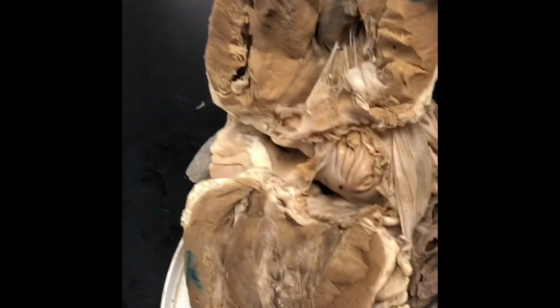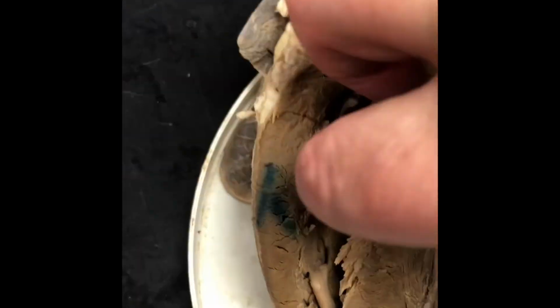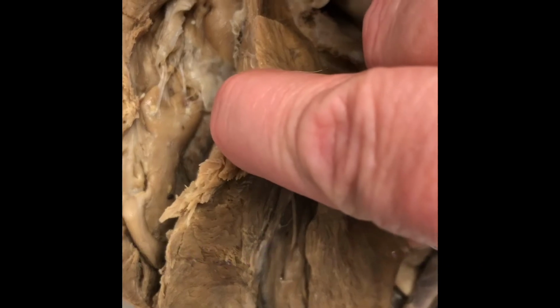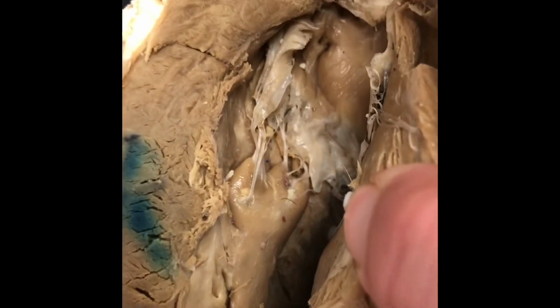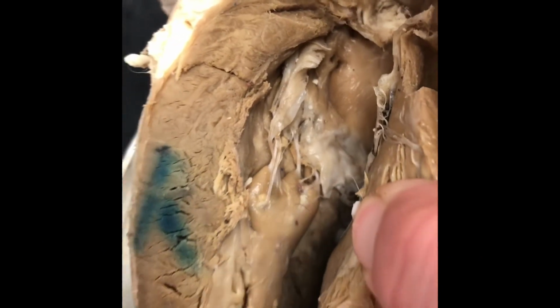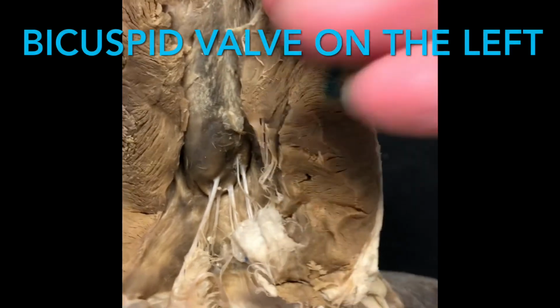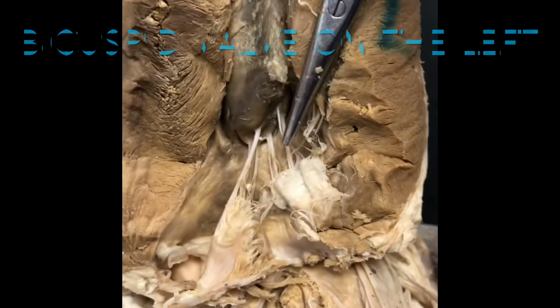But here is the deer heart, and I do have the deer heart labeled, an R on the right side. So you can see the tricuspid valve right down in there, that light section with the strings attached to that tissue. And there's the R there for the tricuspid valve. And here's the left side, and here are the bicuspid valves.